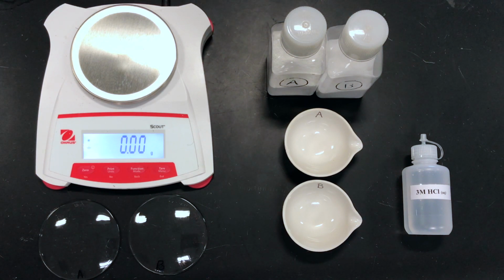of the water, we will determine whether we have salt A or B, either sodium carbonate or sodium bicarbonate, by using stoichiometry from our original mass of our salt. From our initial measured values of salt A or B, we will stoichiometrically calculate how many grams of sodium chloride we should produce.